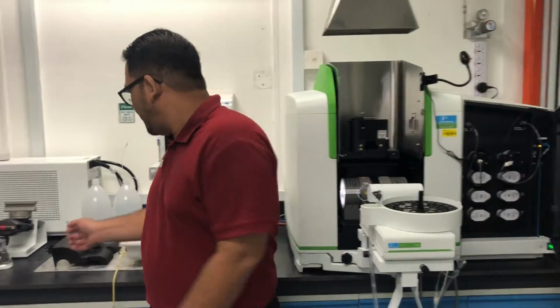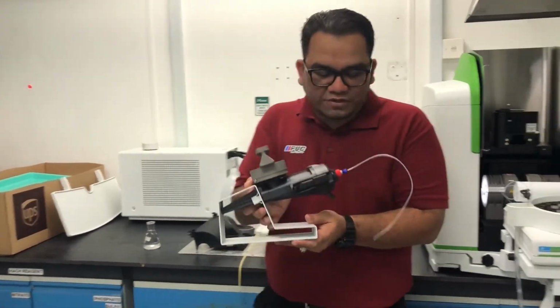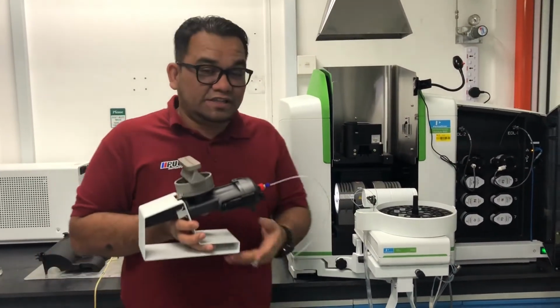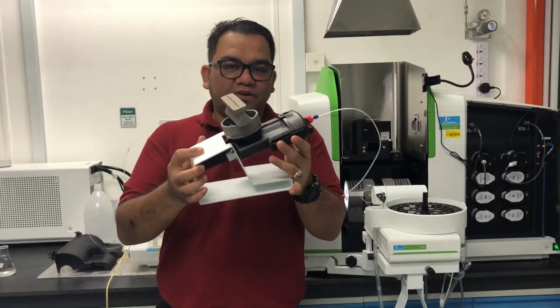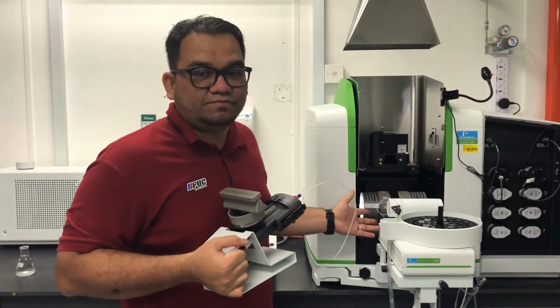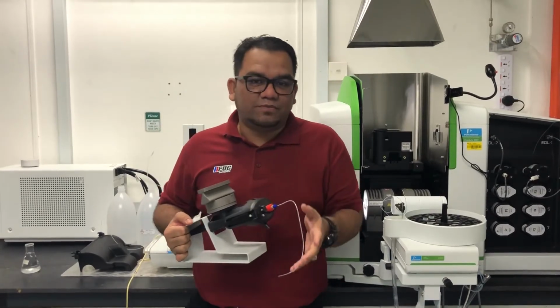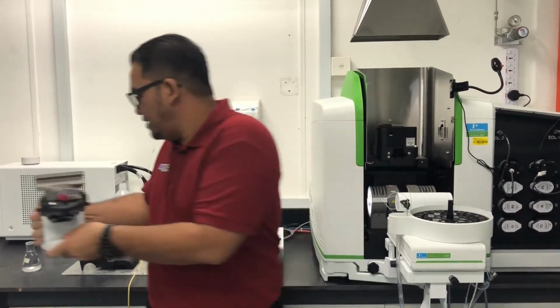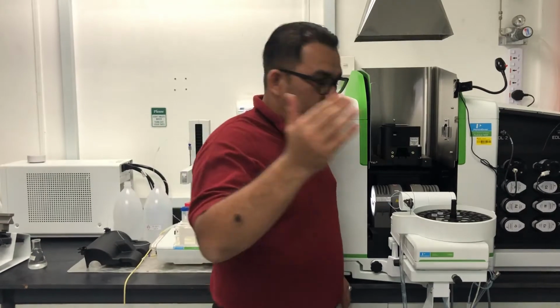Okay, actually you have learned about AAS, right? We have two types of AAS: flame AAS and graphite furnace AAS. Actually, it's not two different instruments. We only have to change the compartment of the flame or the graphite furnace system. It's the same instrument because we use the same concept. We use a source of light, spectrum, and then either flame or graphite furnace. Come on, I will show you.